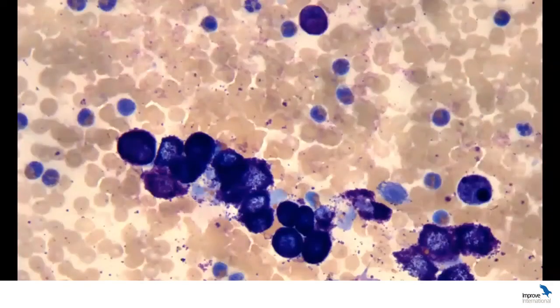But in this case, we were having all of that eosinophilic inflammation due to mast cells. So again, we had to hunt for these in the slides. They weren't overwhelming in all of the slides. You had to go and hunt for them in a lot of the preparations. But when you found them, they were easy to identify. They're rounded, often with lots and lots of purple granules, and they overshadow nuclear detail. That means we can't really look at what's inside that nucleus. It's going to be really tricky to identify if they have nucleoli or any of those features for malignancy.